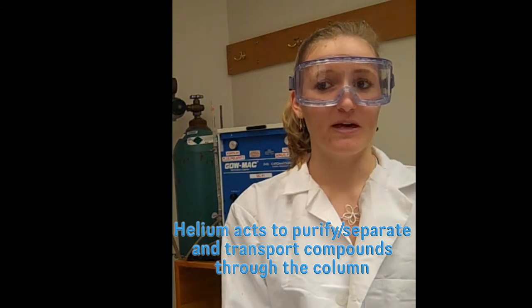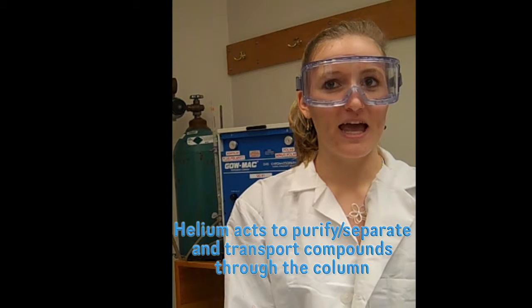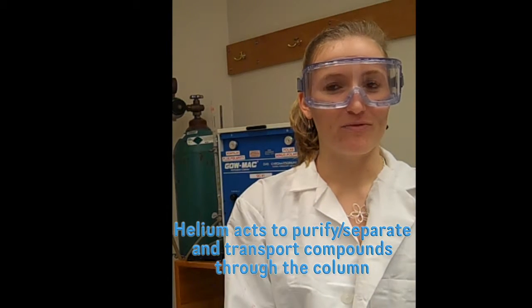The polar column contains a polar stationary phase made of carbowax 20M, while the nonpolar column contains a nonpolar stationary phase composed of DC200. As the compounds move through the GC column, they travel between the stationary phase, where they stop and interact, and the mobile phase, composed of a gas, usually helium, that acts to both purify the compounds and transport them through the column.